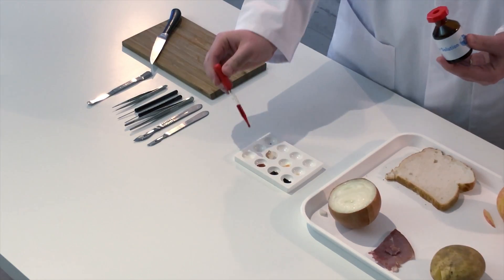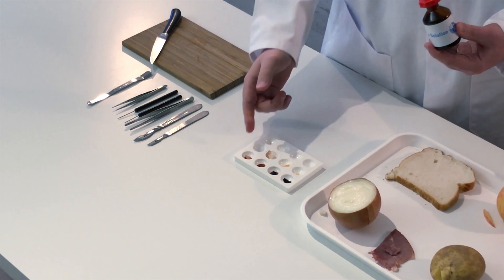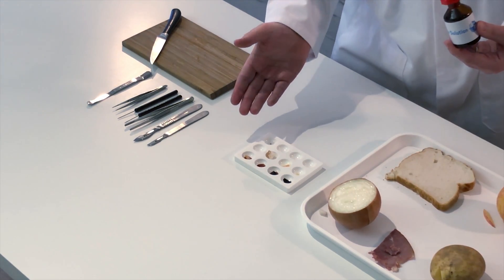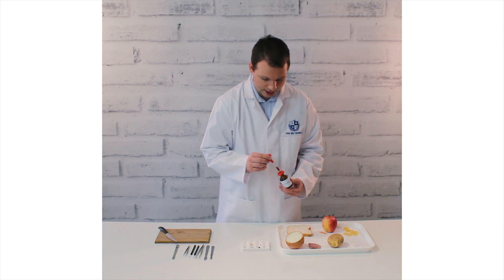Onion. Again, orange. Pretty much no blue-black color in there. Look at the comparison between onion and potato. Very nice and clear.